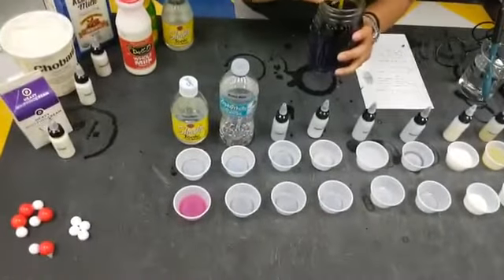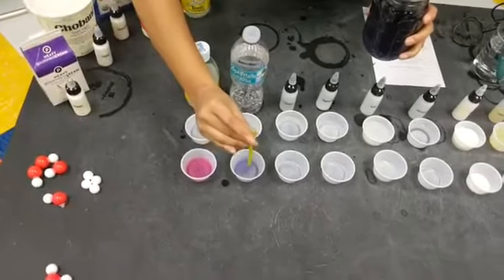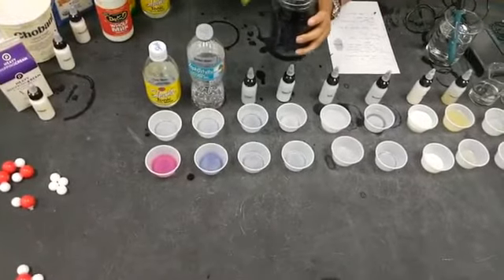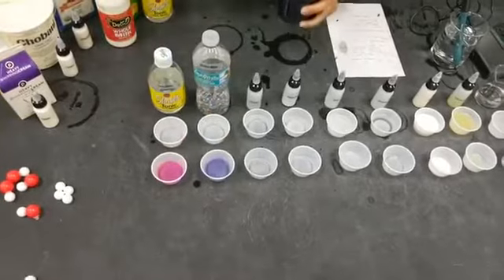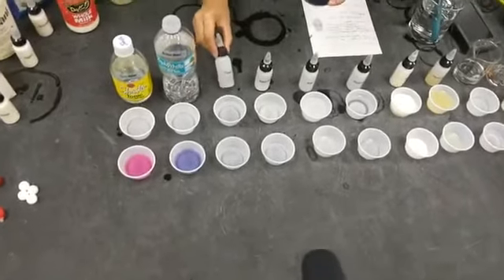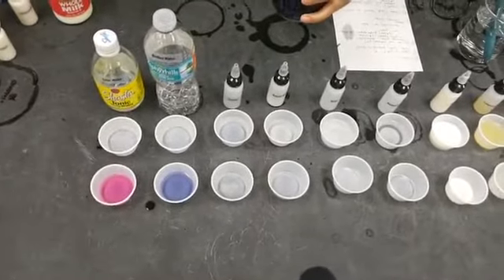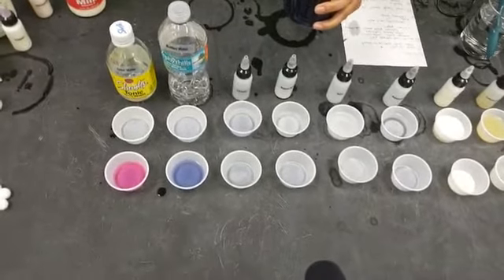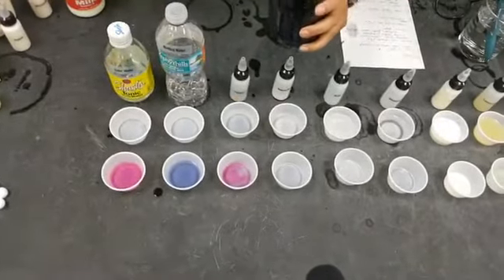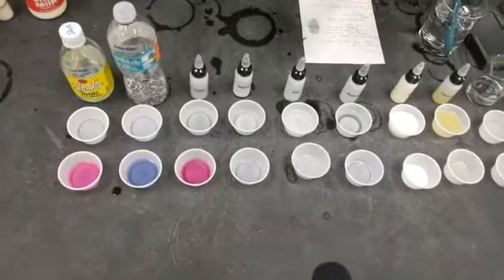So our next sample is some bottled water. Right, that looks like it kind of stayed purple. We could put a little bit more in if we think our color is not strong enough. Right, that's pretty purple. Our next sample is vinegar. Do we have any guesses? Do we think that's an acid, a neutral, or a base? You might know this one already. Right, that looks like an acid.